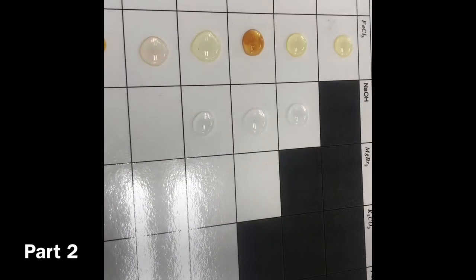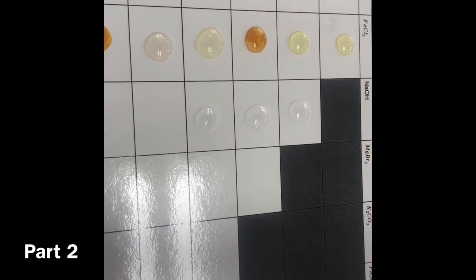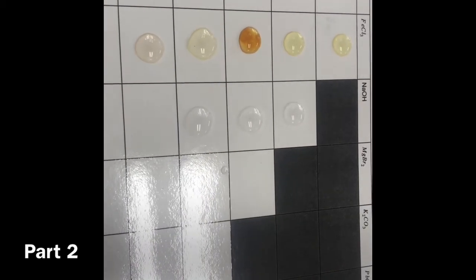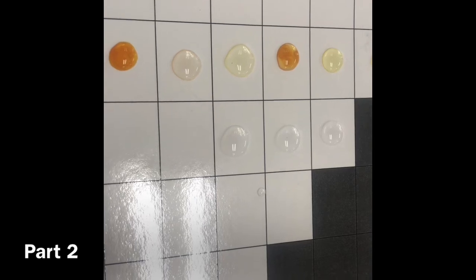Okay, here we go. Third one coming in. This one's gonna react. I can feel it. It is Fe, right? Nope, it is Pb. There's our Pb. Here it is. Guys, I can feel this one. It's going to change. Okay, I could hear that. Yeah, you spilled the drop on me. My bad. We can wipe it off, but I was wrong, you guys. That one didn't react.